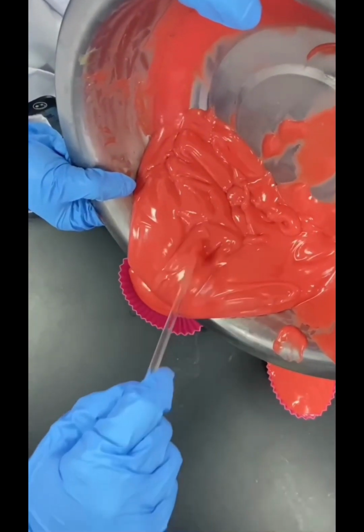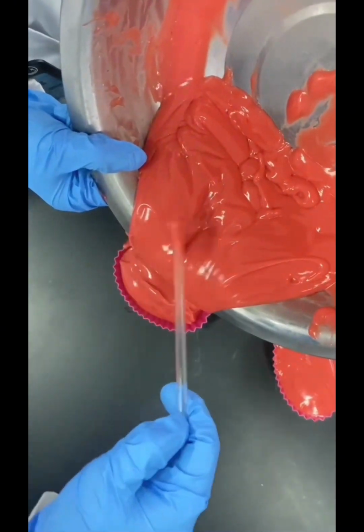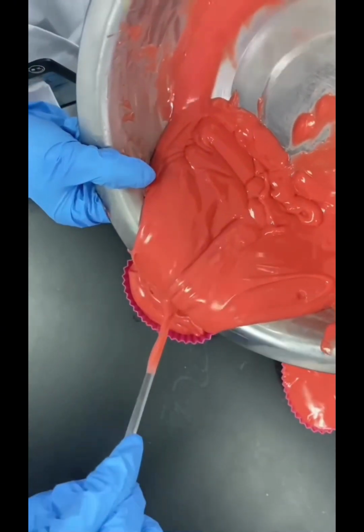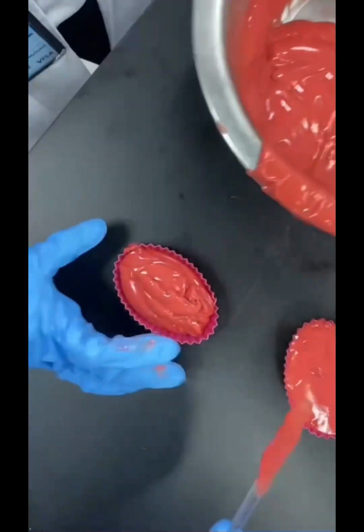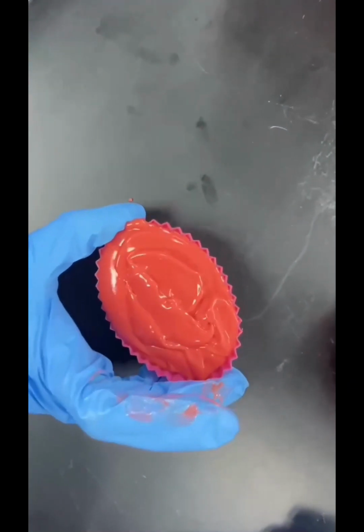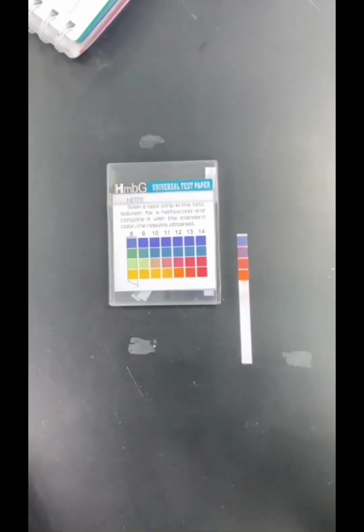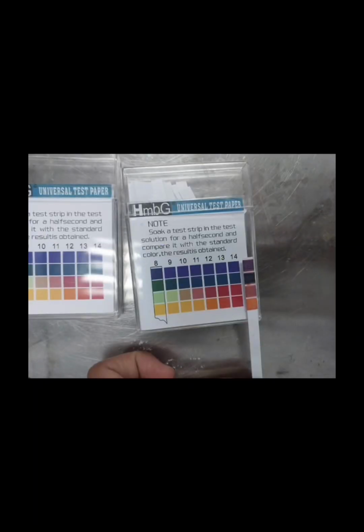After the mixing process of making soap from the used cooking oil, the texture of the soap is quite viscous and thick, resulting in a pink color. After a few hours left at room temperature, the soap solidifies according to the prepared molds. The steps to calculate the pH level are used to determine the quality of the soap. The result is a pH level of 13.